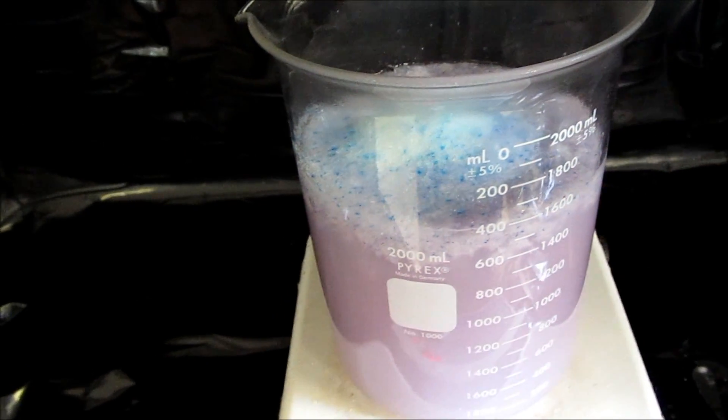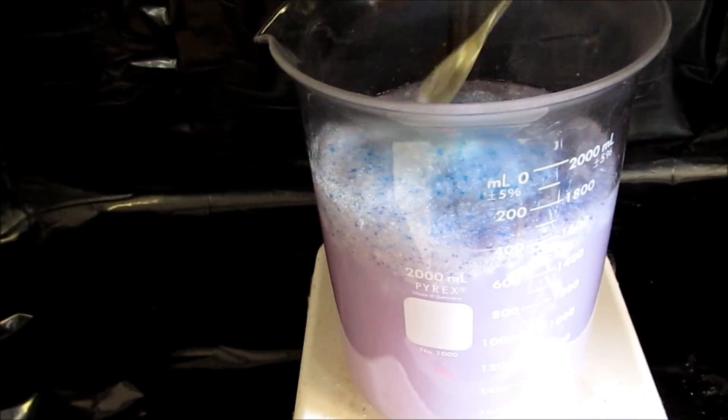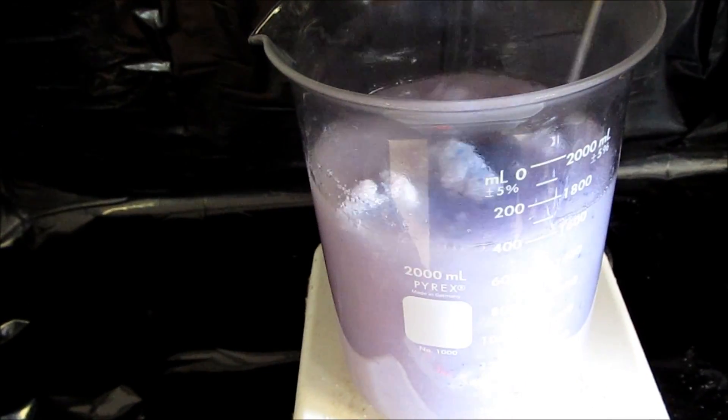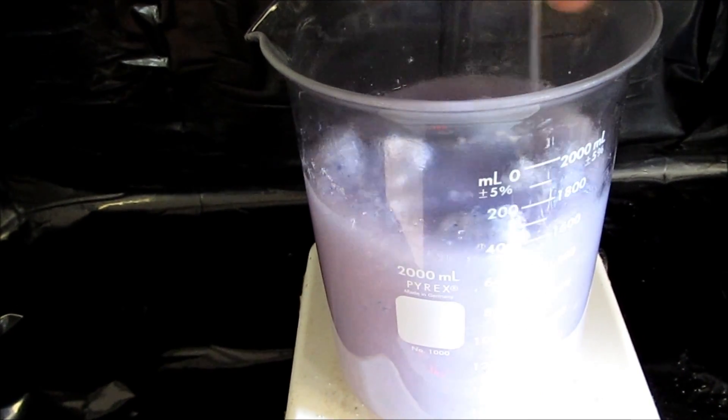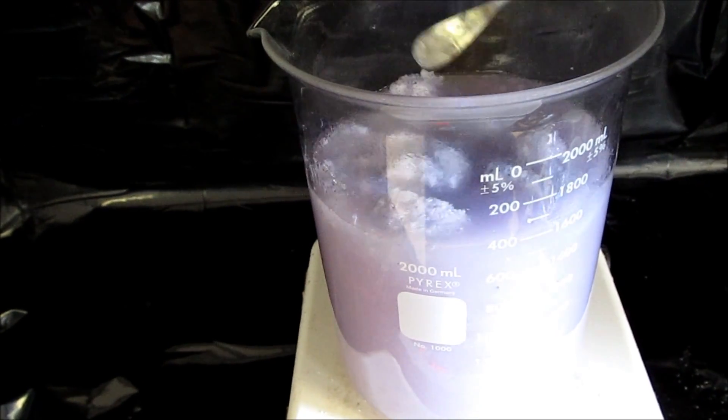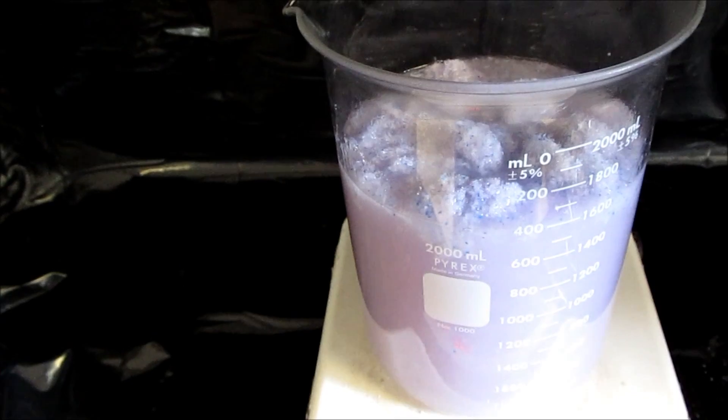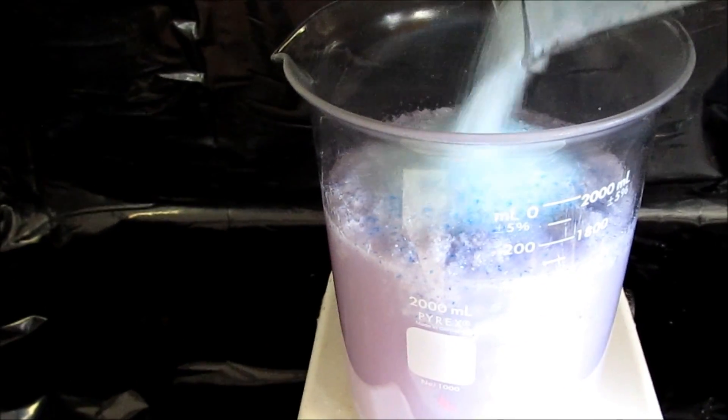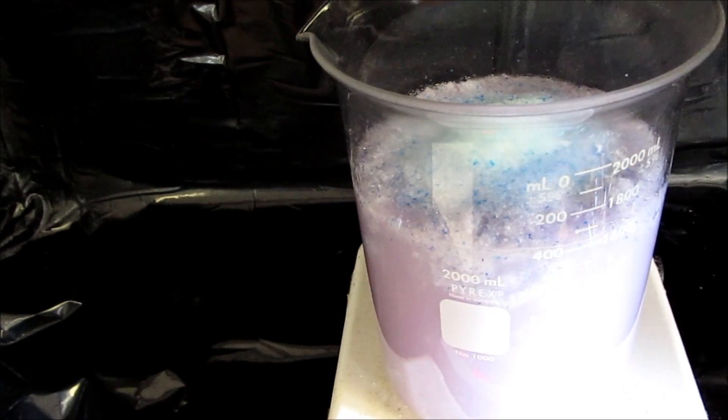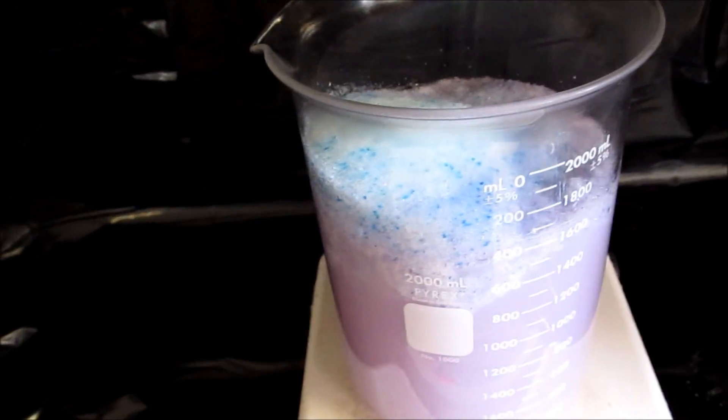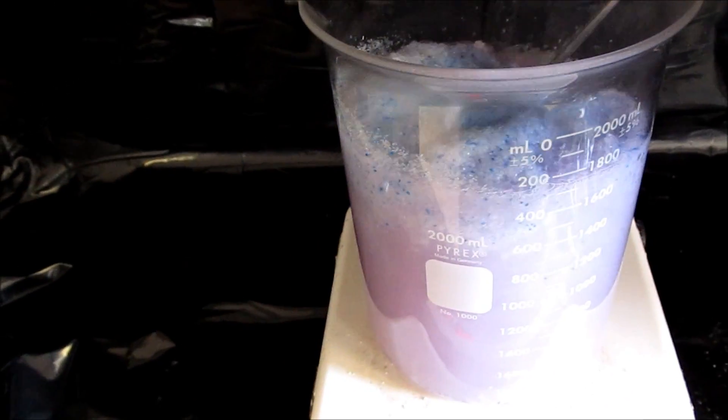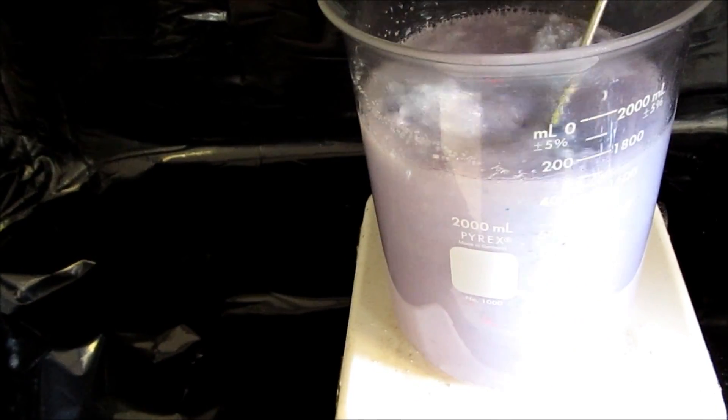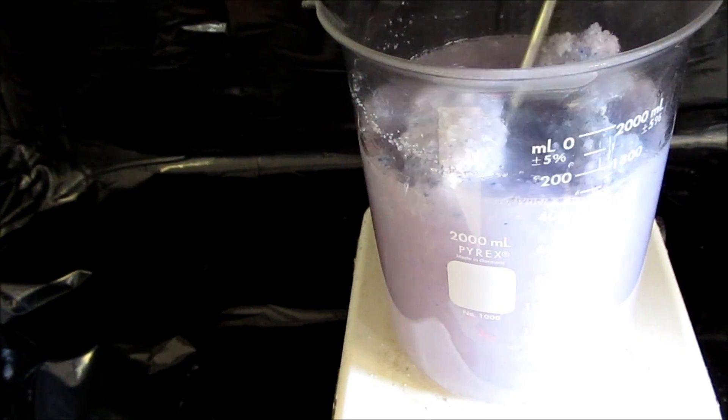Uh oh, I bent a little bit too much. I know, I know, I'm not wearing gloves, but this is only caustic so I can wash my hands. It's 50% by the way, so it's industrial strength.